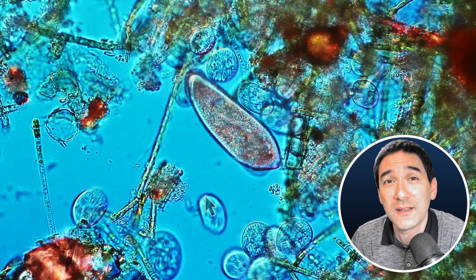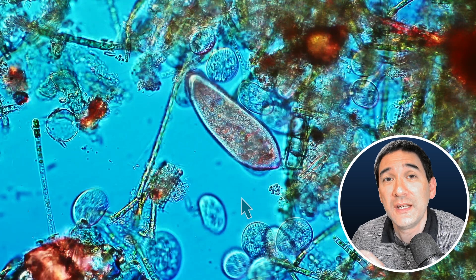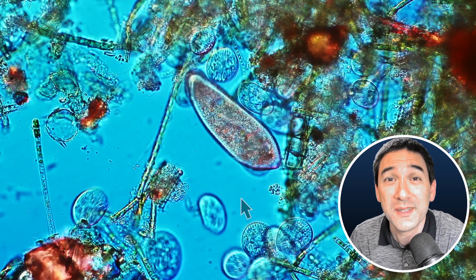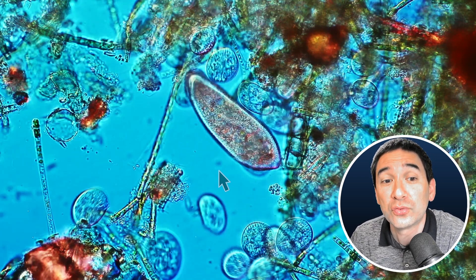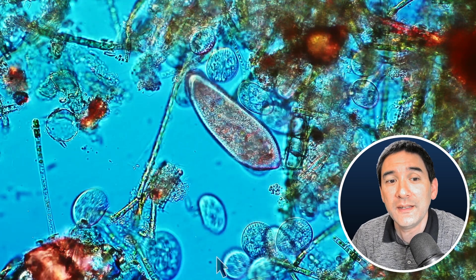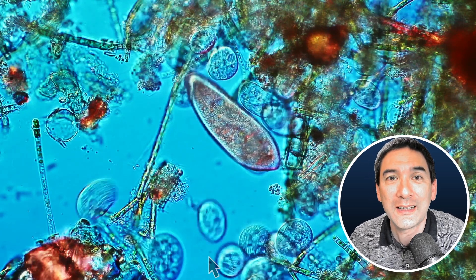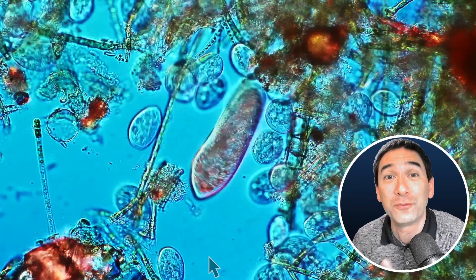Essentially the refractive index inside the cell is different from the outside, because the inside of a cell contains many, many different substances — minerals and salts and whatnot, millions of different substances at a high concentration sometimes. And this changes the refractive index relative to the surrounding medium. This is why the microscope produces those dark lines. It's a little bit like this: you're still able to see a glass of water standing on your table, even though the water is transparent and even though the glass is transparent — both of them are transparent. Still you're able to see it, and that is also because of the difference of refractive index.